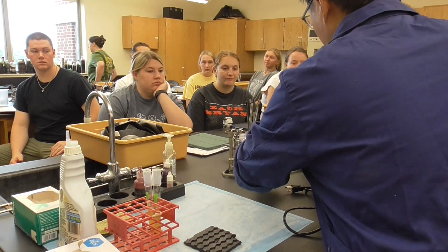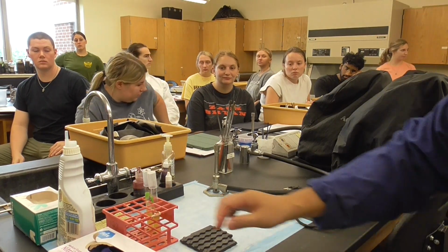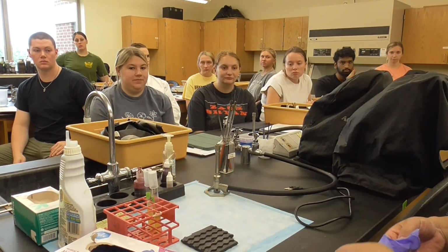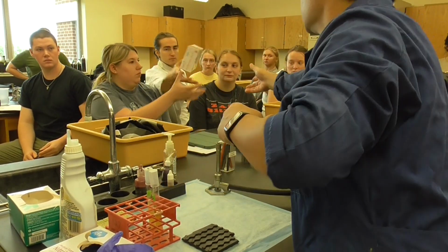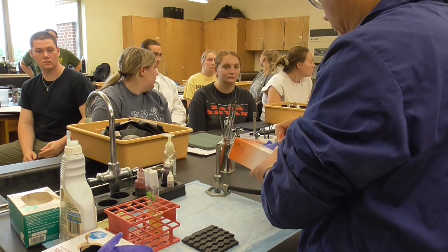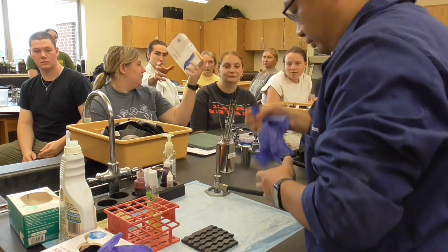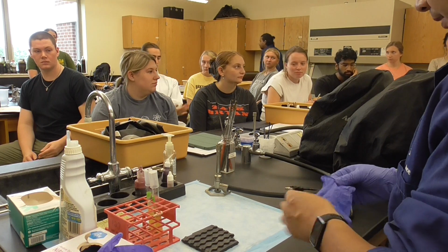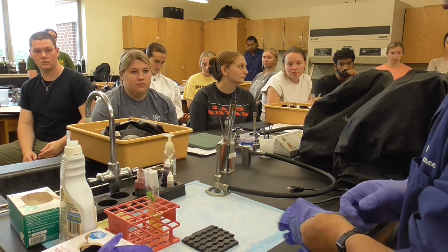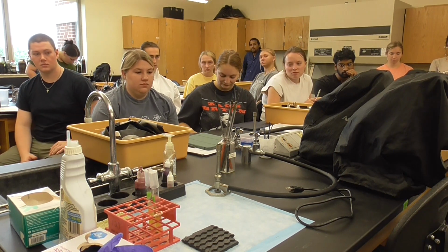Okay. Now I want to show you how to use the Bunsen burner. So first of all, everything is ready when you clean your bench. Does anybody have large gloves? Yeah, I can borrow. Thank you very much. We have some here. Oh, okay, just grab some. Thank you very much. I'll just put some in the back. I'll just borrow one of the wraps here. Do we have one? Okay, I'll use it. I'll just give you an example.